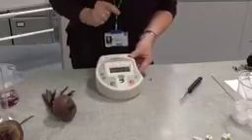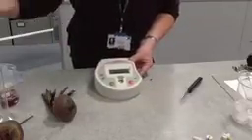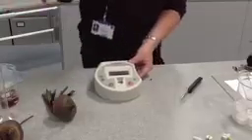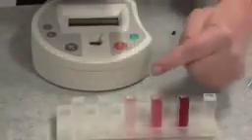So I've set this at the green filter, and we're going to see how much green light is absorbed by the water that was kept at different temperatures. Right, so what I've done next is take the beetroot out of these, and I've decanted some of the liquid into different cuvettes. These are our little cuvettes that we're going to place in the colorimeter.